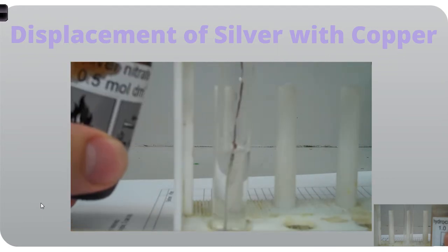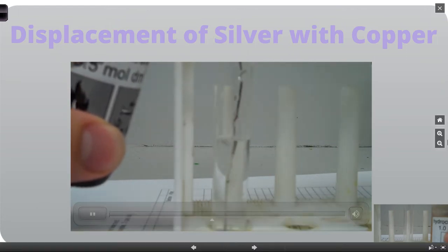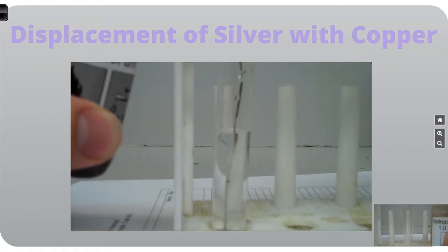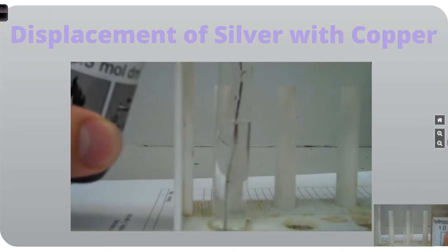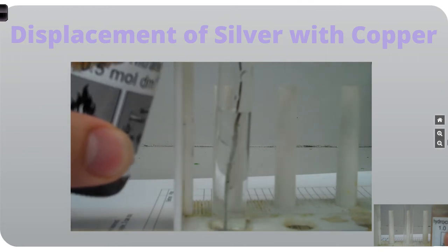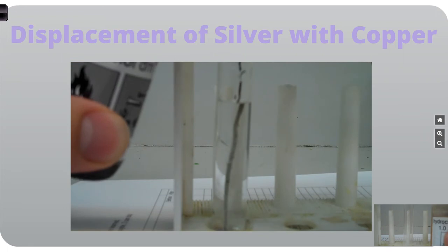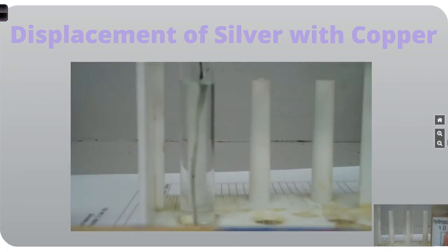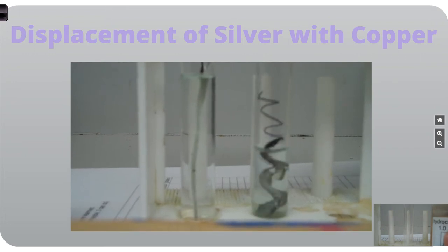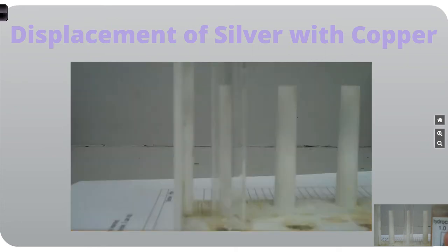So just topping that up, there we go. And you can see that the wire is much more silver down the bottom there. Especially look at the top end, as I'm adding fluid, you'll see it change from that reddish, brownish color to a more silver color. I know it's not the clearest video, but you can definitely see it there. You can see at the top it's a lot more silver. Now there's one I prepared earlier. You can see a whole lot of silver forming in the place of where the copper was.